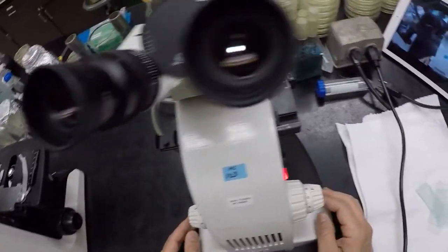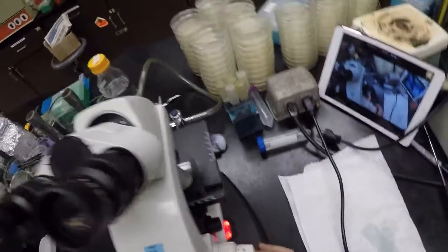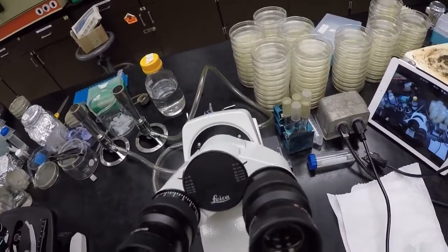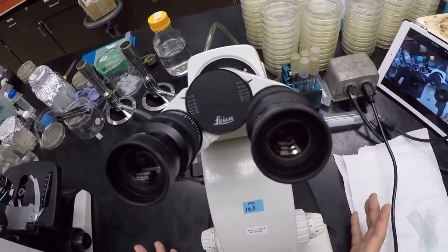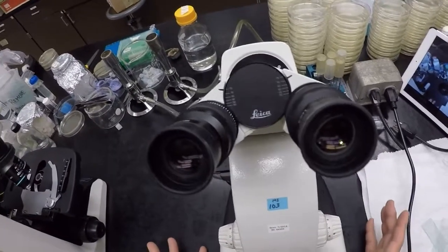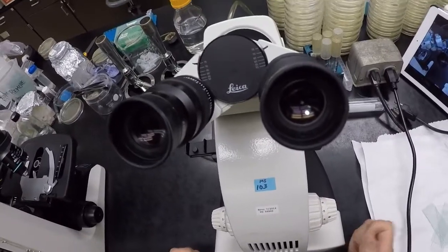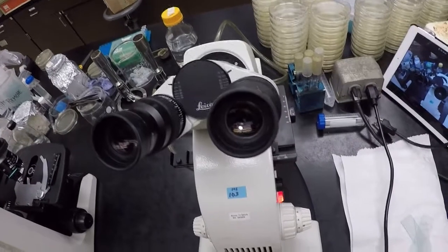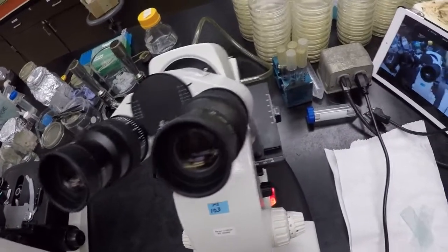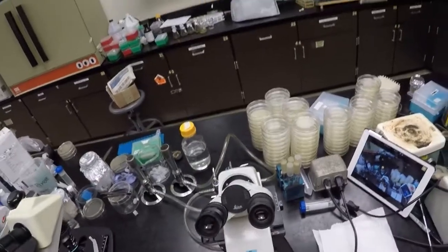Okay. Finally, the oil immersion lens. And now the oil immersion lens is called that because it absolutely does not work without oil. The field of vision in the oil immersion lens is so small, there's not enough light gathered into the lens for it to be able to focus. So the oil helps increase resolution by bending light towards the lens. Okay, so let's go grab some oil. I forgot to prepare it with me, but it's right there behind me.